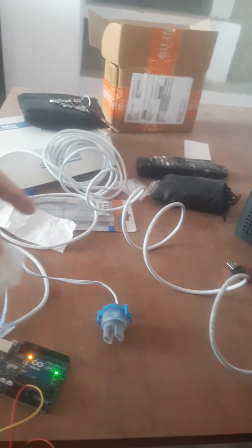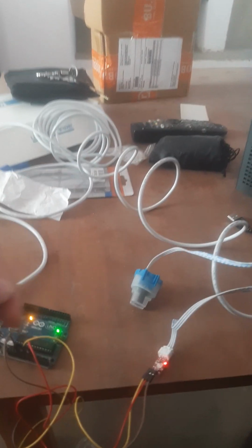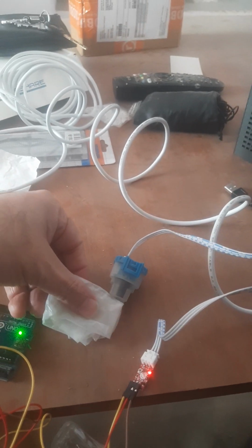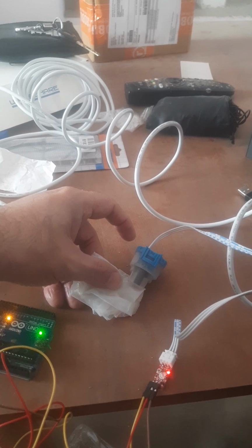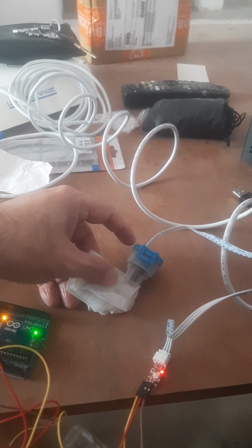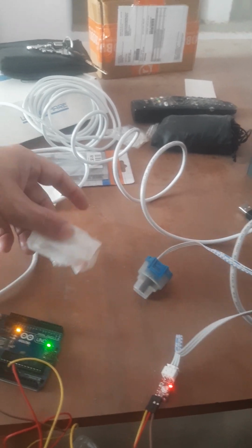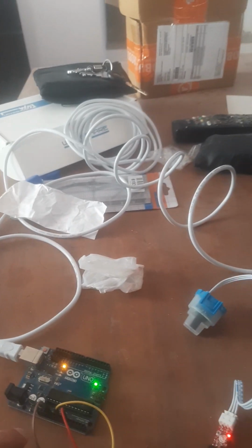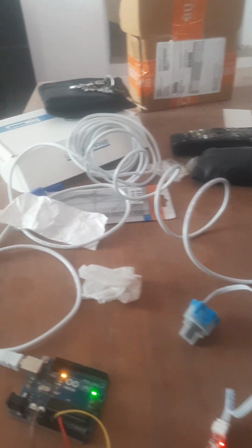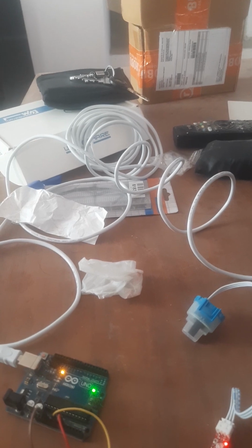As you can see, or maybe not see, now you can see maybe. There is an LED light, and once we feed something into the two grooves between which the turbidity is to be measured, the light changes its color. And the three wires: one goes to the power supply, I've put it at 5 volts here, another to the ground, and another one gives the reading to the analog port.